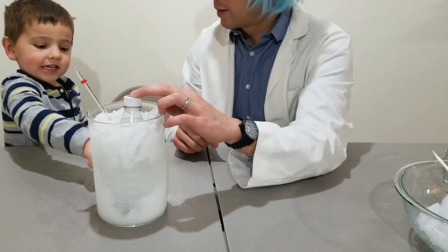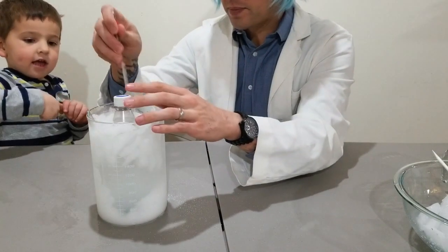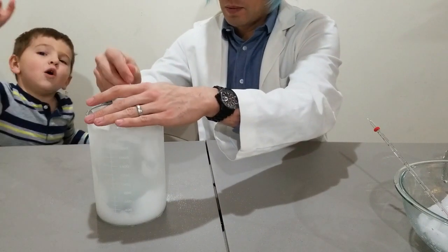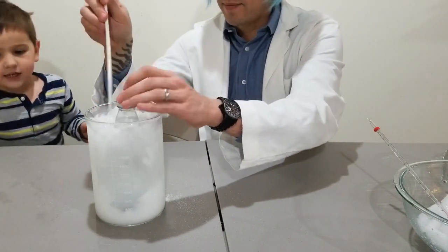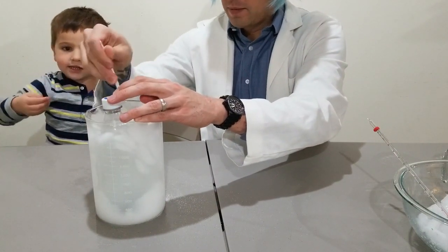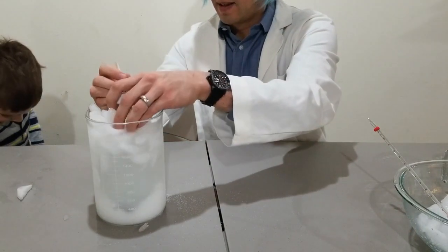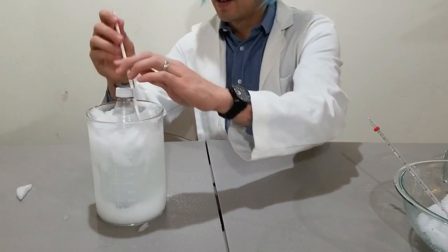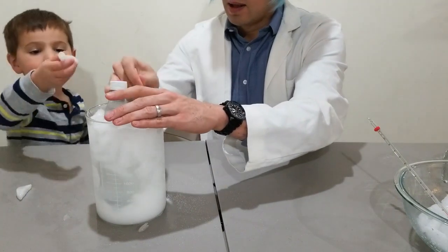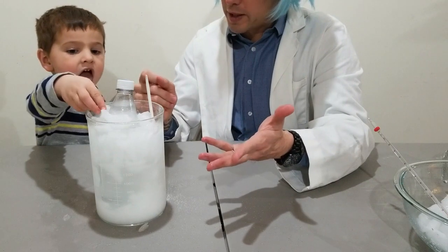When we scratch the frost it turns into ice, confirming what's on the outside is frozen. The salt is what's making it so that the water inside the beaker is not freezing. If we could take all the salt out, then the water in the beaker would freeze.